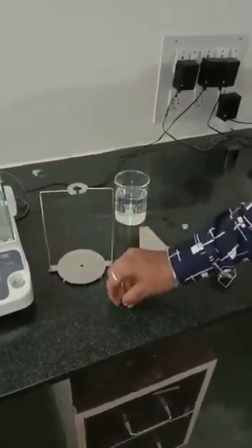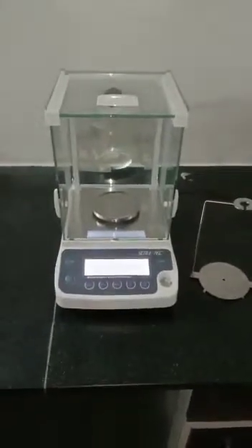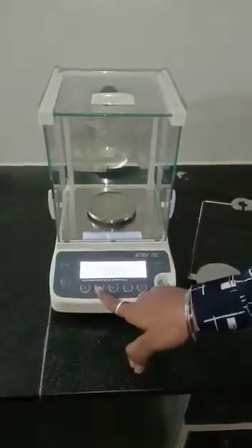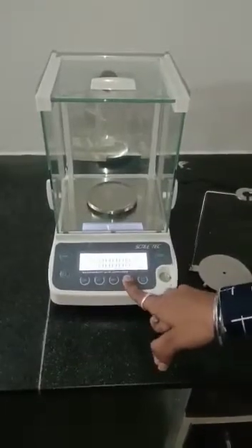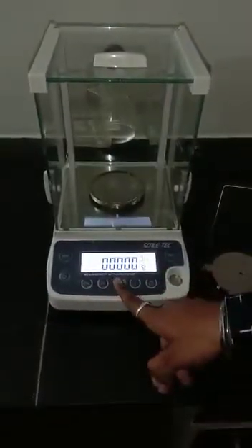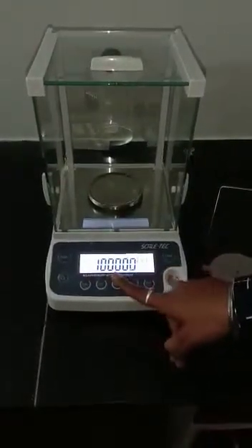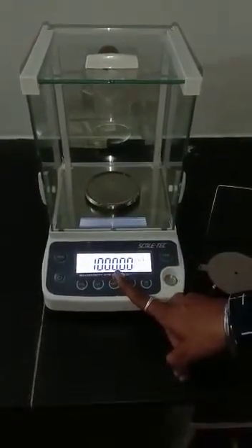For doing the density measurement, what you need to do on the balance: you can see the CF menu and F key. Press the F key and you will get the density on your display. Now press the one menu and you will get the value one — this means we have by default set the density of water in this balance.